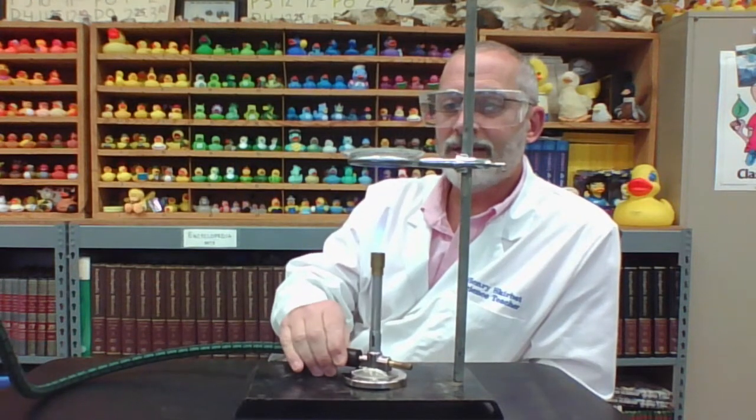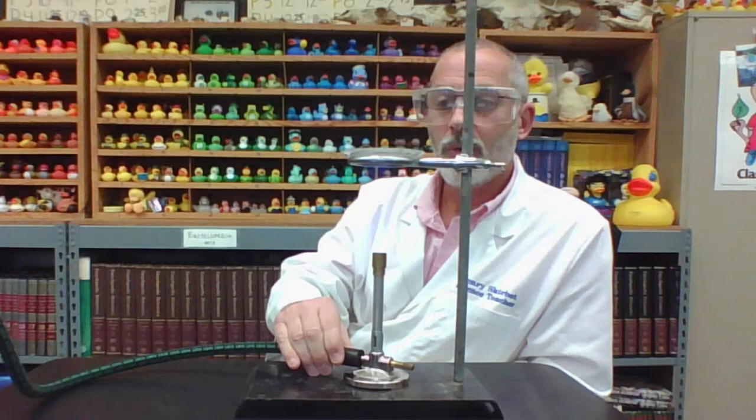Now, as we have our burner lit, you should be able to observe. I'll get out of the way here for a moment. You should be able to observe what type of flame we have. Is this a good flame or a bad flame? It's a bad flame. And how can we make this flame a good flame? By adjusting the collar. So I'm going to adjust the collar, allowing more airflow to combine with the fuel. And now we've got a good flame. Maybe you can even hear the roar. And now I'm going to place the burner underneath our evaporating dish, and we're going to observe what happens.